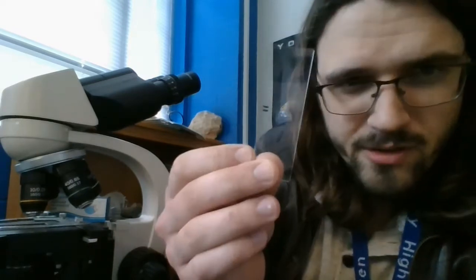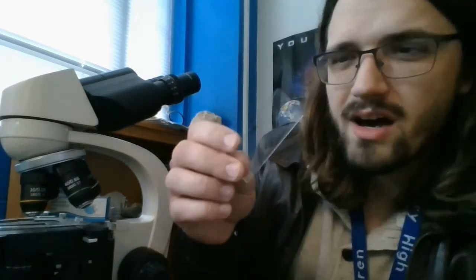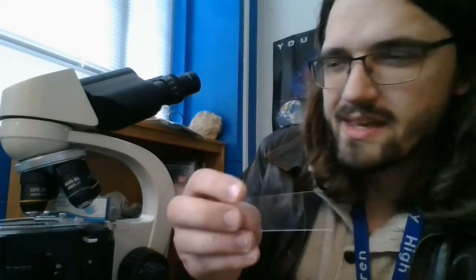And so we can put this under a microscope and see what it looks like, and that'll give us an idea of the sort of scales that we're seeing on the microscope. For example, if this takes up the entire view screen, we know that the entire view screen is about 3 millimeters long. So let's see what this looks like under these different magnifications.